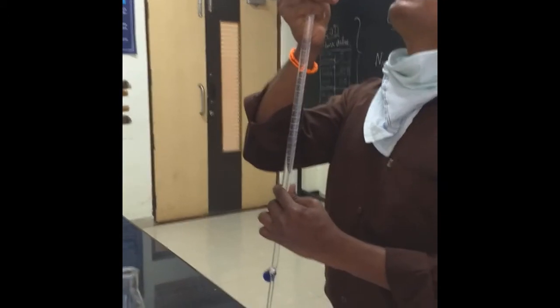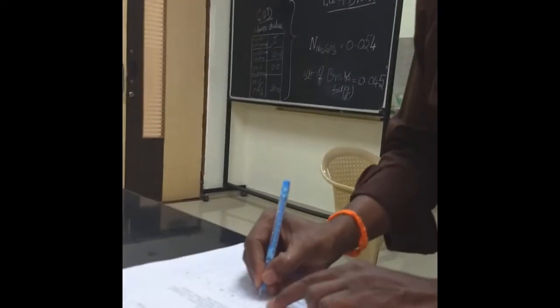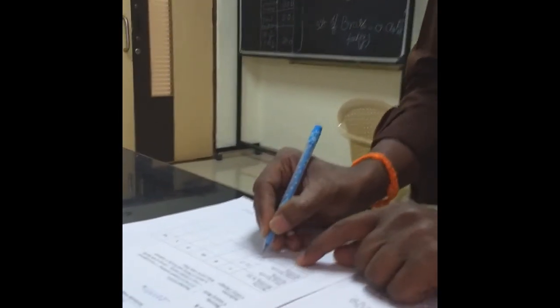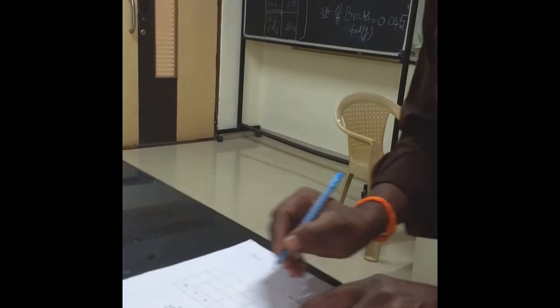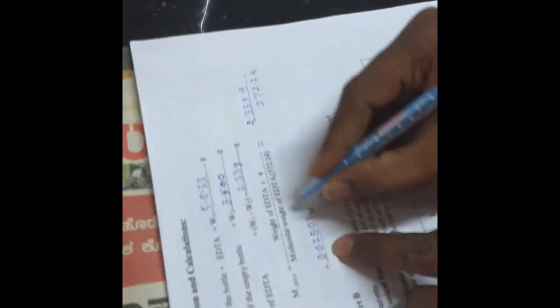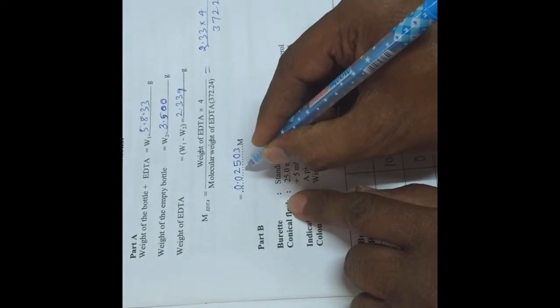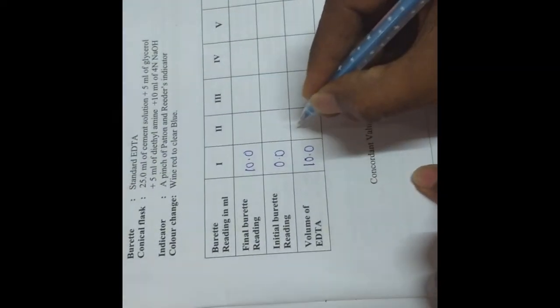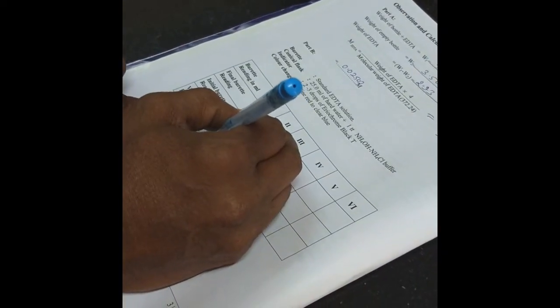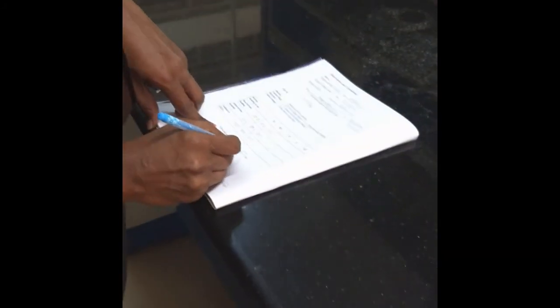The reading is coming to exactly 10 ml. According to the weight of salt, the titre value will change — whatever you got, just write it. This is the final burette reading; the initial burette reading is 0, giving 10 ml. We have taken the known weight of EDTA by taking W1 and W2, and that weight needs to be multiplied by 4, divided by 372.24, to get the molarity. Now like this, you need to repeat the titration for getting concordant titre values — 10 ml — and similarly I got 2 more trials carried out to get concordant titre values, also coming to 10 ml.